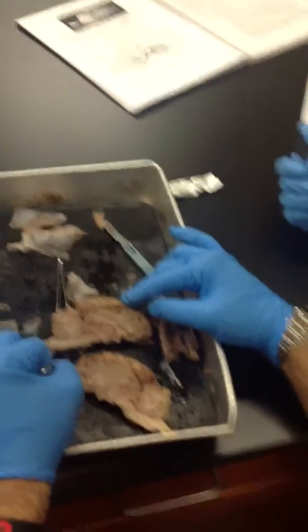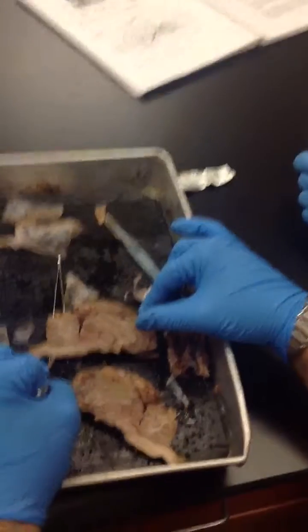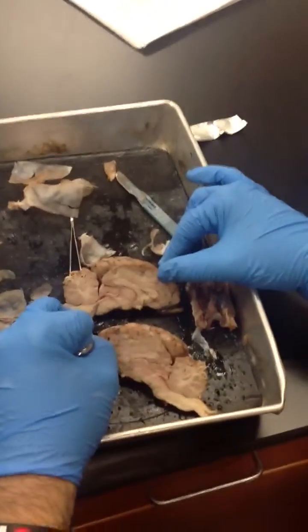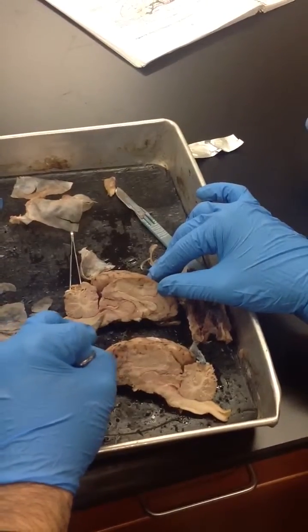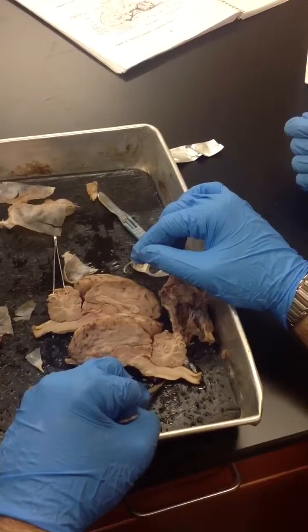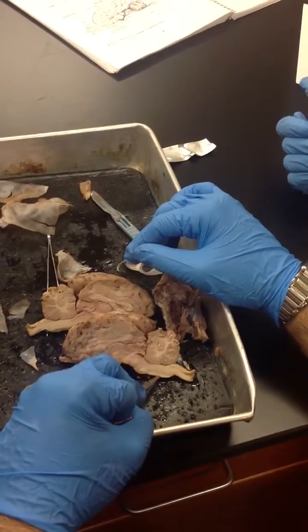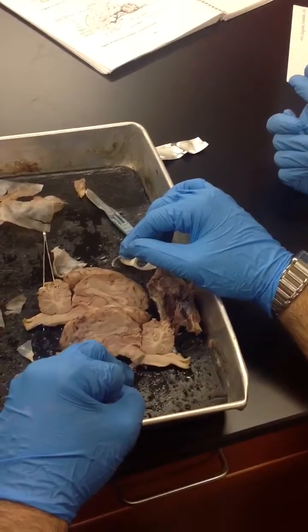Then you have the first bump that occurs, and it's usually right under the cerebellum, is the medulla oblongata, and then the second bump is the pons. So first bump medulla, the second bump is the pons. That's a bad example. I would say it's like right here. This is the first bump here, and then this is the second bump right there. And that's the pons.